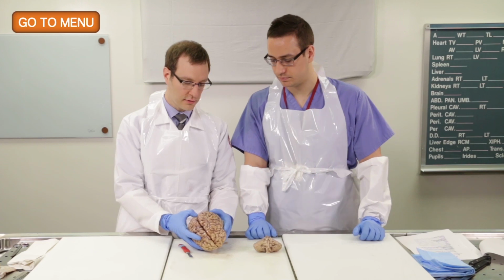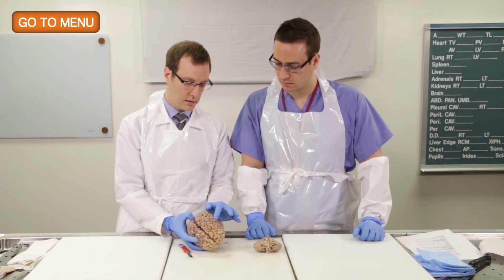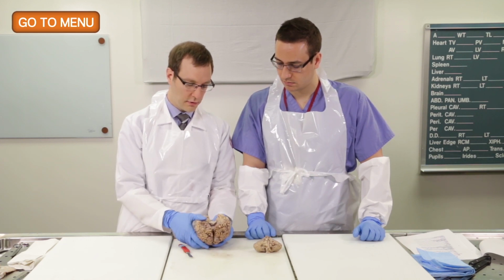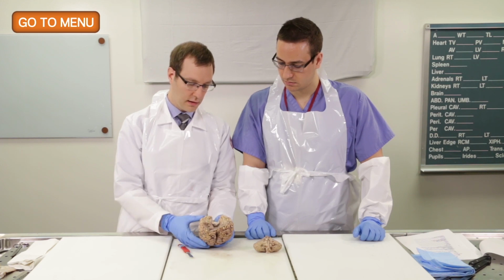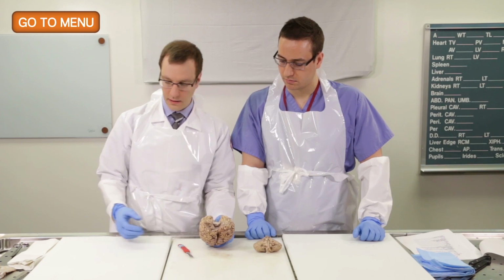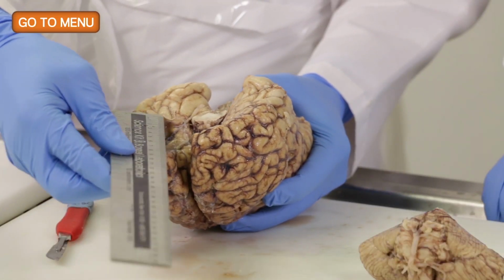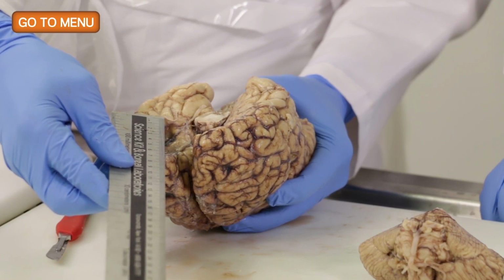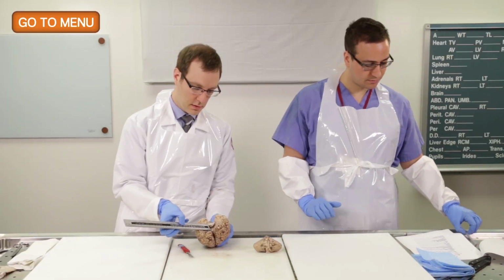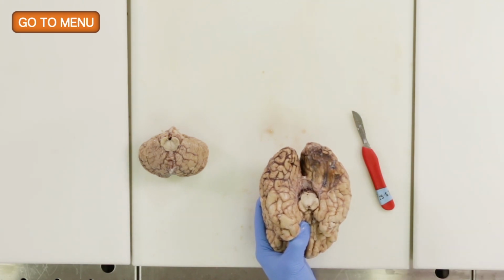And that's actually on the contralateral side of where we saw the other infarcts. So we saw one here in the superior left hemisphere, and then we see another infarction on the right side in the inferior occipital lobe. So we'll take a look at that again, obviously, when we cut the sections, but why don't we measure this so that we have a basic idea of how large this lesion is here. So it's about 6.5 centimeters anterior to posterior, and approximately 3 centimeters medial to lateral.